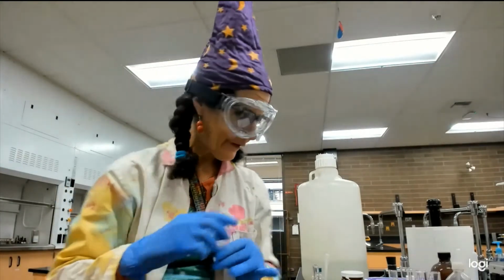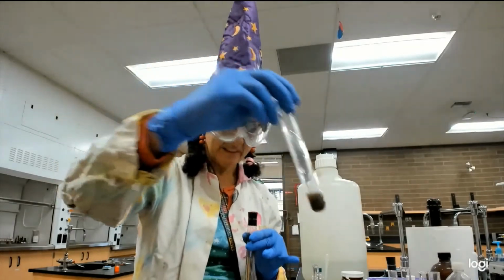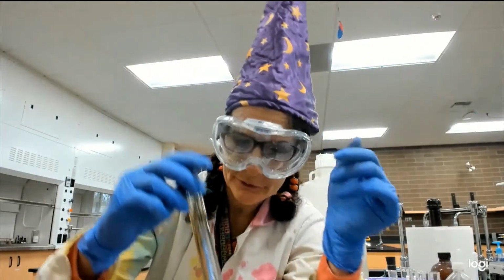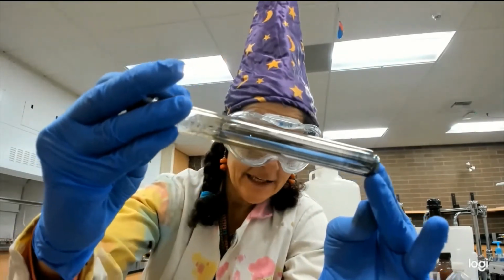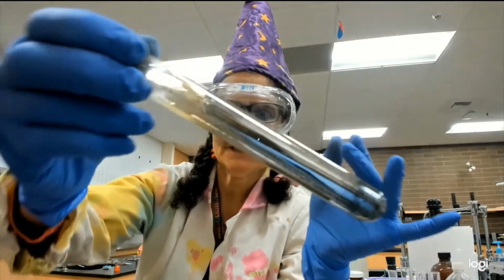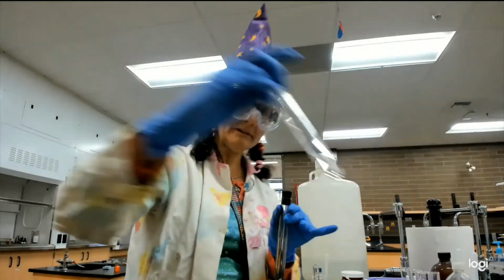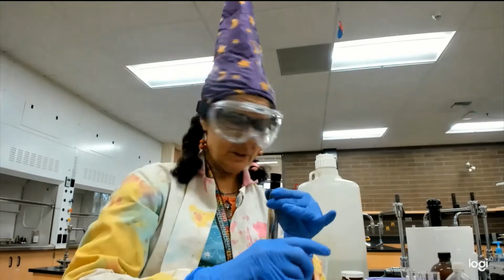So, remember that mud we had? The mud, we were sticks in the mud. None of you are sticks in the mud. You're all beautiful lotuses. But this is what we got. I don't know if you can see that, but you can see yourself in there. And so we get this beautiful silver coating. And this one, well, it's no longer a stick in the mud, but it didn't make a silver coating.